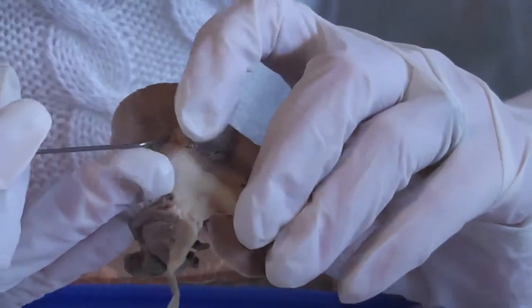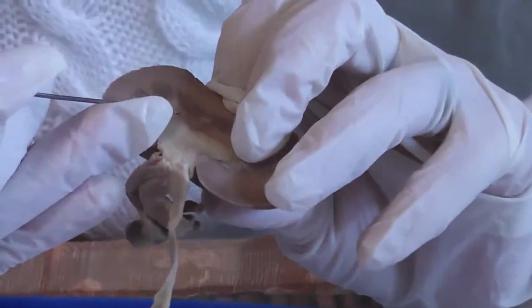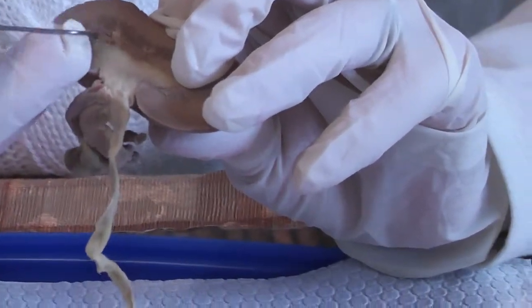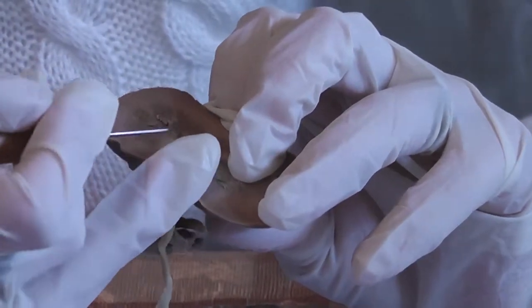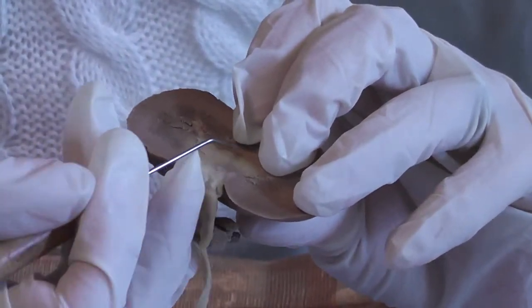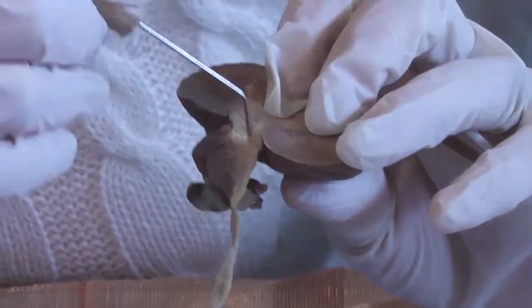Is this better? Yes. Okay, so right underneath the renal papilla are the minor calyces, and they drain into the major calyces. They actually merge together into the major calyces, so this would be a minor calyx right underneath the renal papilla, and then when they merge together they make up the major calyces. Now the major calyces then merge into this area of the kidney right here, which is called the renal pelvis, and through the renal pelvis the urine actually goes into the ureter.